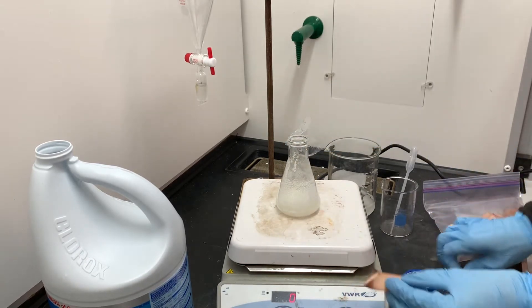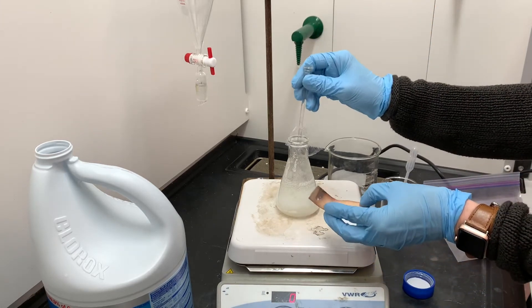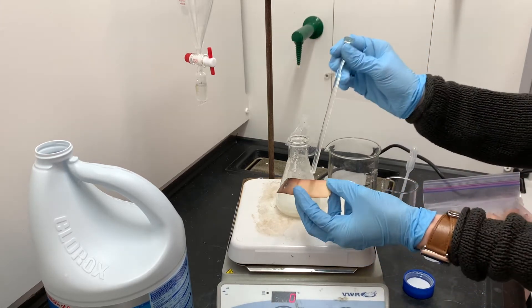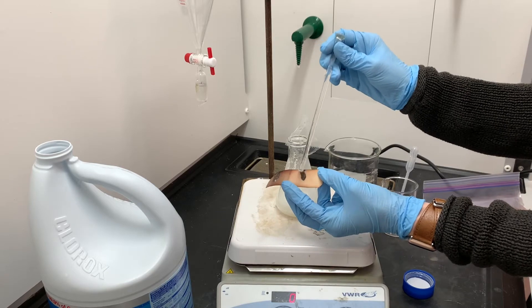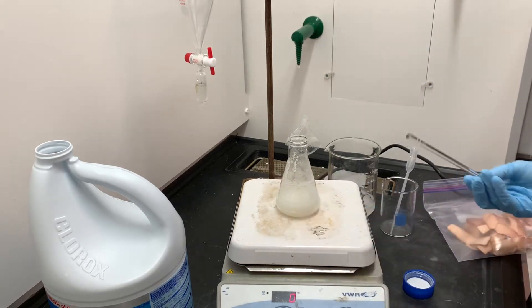So once I get a little bit in there and swirl it up, I'm going to test again just to make sure that I've added a good amount. And there we see we have that nice dark color again, so we'll let it continue reacting.